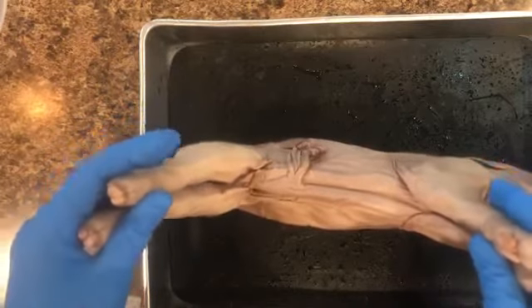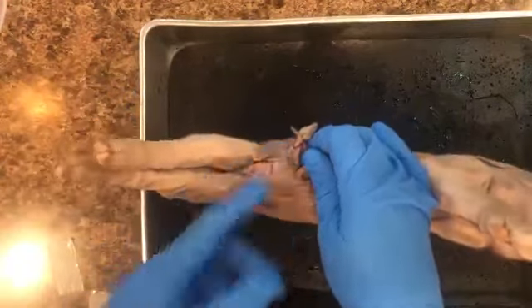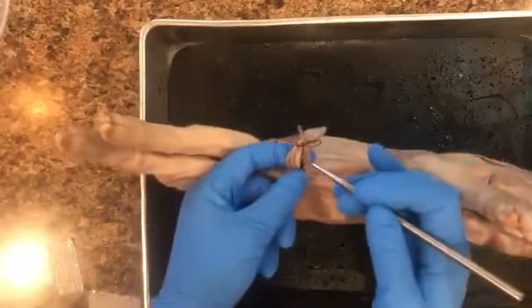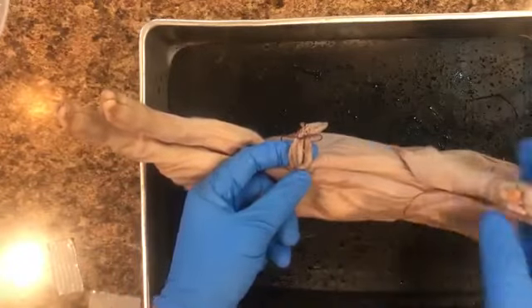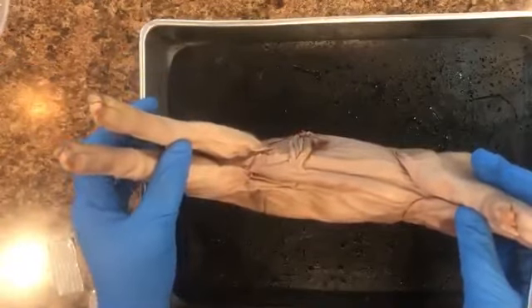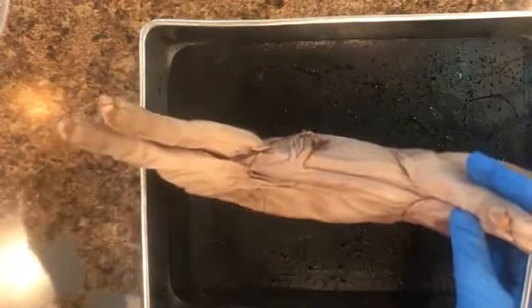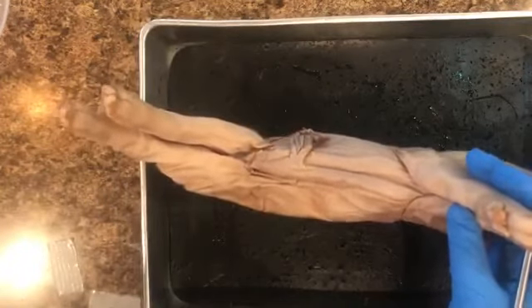These ones are non-injected. So for me to sit here and be like, oh, well, this here is the artery and this is the vein, very hard to do just because they are not injected. We are only using the fetal pig over the course of a few days, where there are some courses that use the fetal pig over the course of weeks and weeks, because they learn all the muscles and go into way more detail.